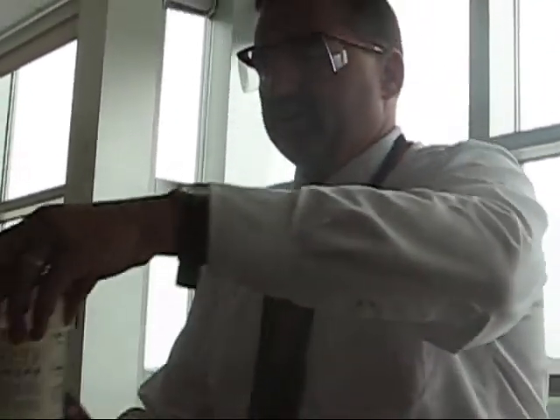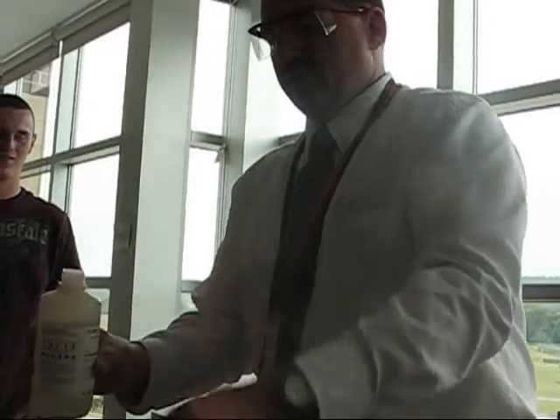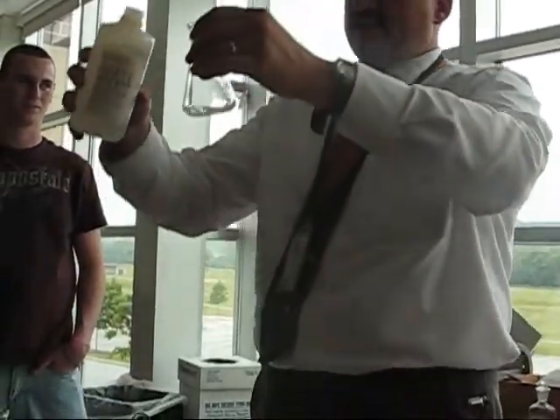Anybody getting an odor? It'll smell like chlorine a bit, but it's not. It's bromine. See? If it's bothersome to you, then please move away. Don't sit there and just take it. Try to get some mana points or something. Like I can take it. Let me breathe the fumes directly.